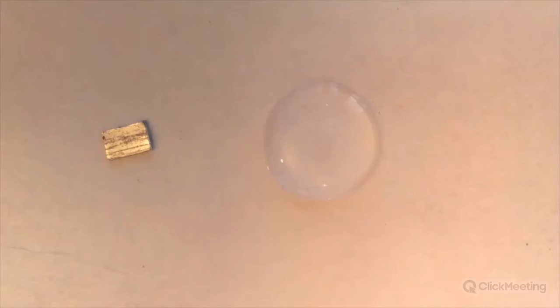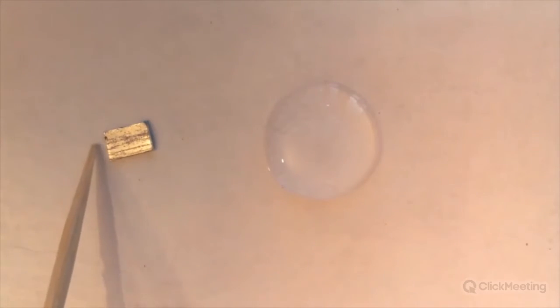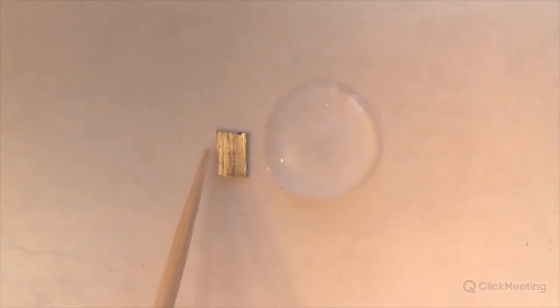So after you've got the pupils to identify signs of reaction, such as color changes, you want to identify other signs that a new substance has been formed. So if you add magnesium to a drop of 1 molar hydrochloric acid, the pupils can see quite clearly that we're going to get a gas produced.